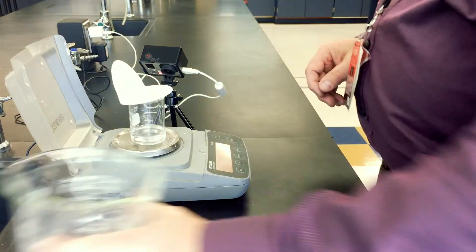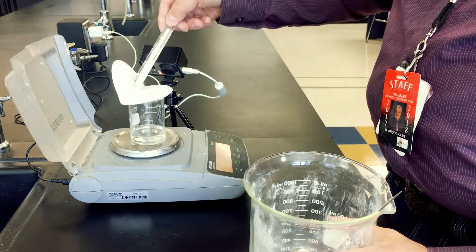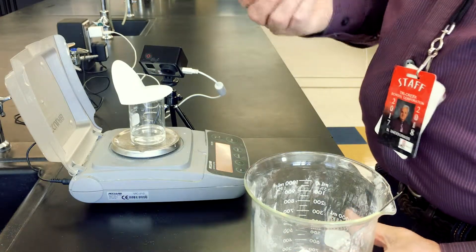Turn the scale on and zero it. There's more than one way to do the massing of the reactants, but we're going to do it this way because it's going to very clearly illustrate the change in mass as the reaction takes place. 20 milliliters of the acetic acid, and I'm going to use the filter paper. I'm just going to put it on the scale with the beaker and the acetic acid. Then I'm going to use the supply of sodium bicarbonate and just add it to the filter paper until I get around 74 grams total.